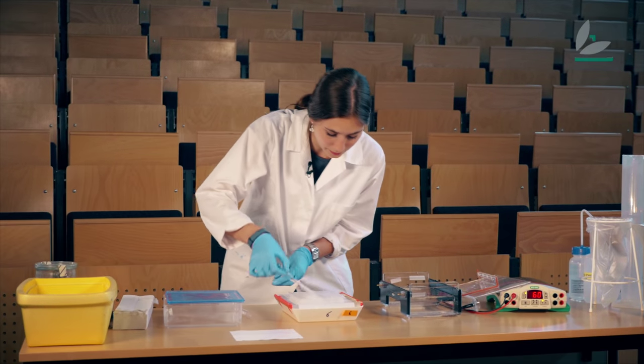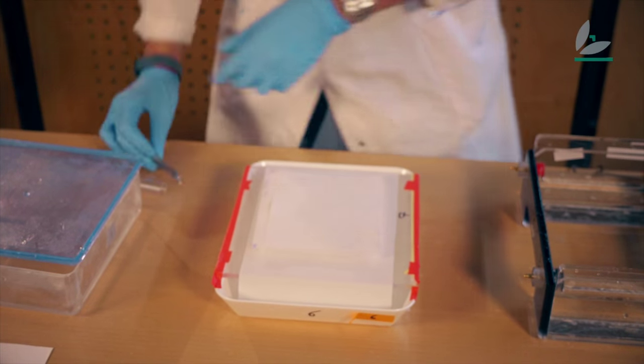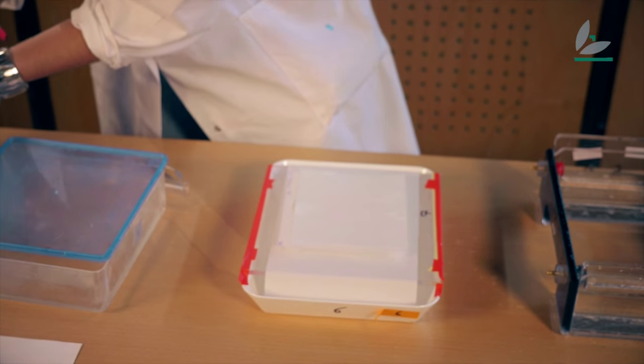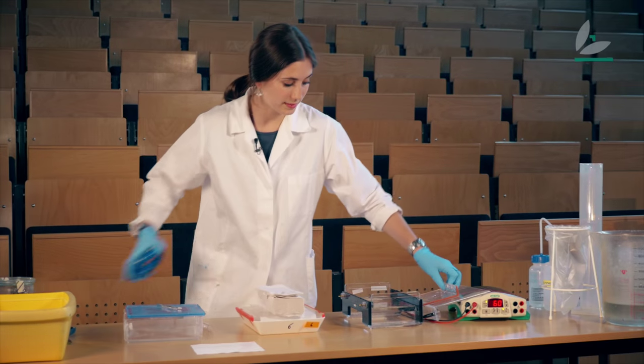Now I'm going to put some more paper on top and a lot of paper on top of that with some weight.